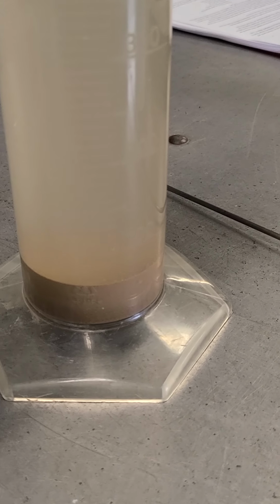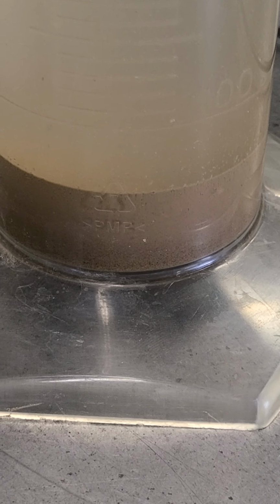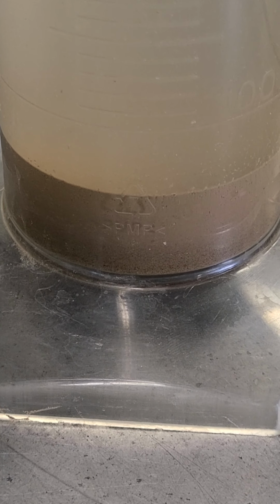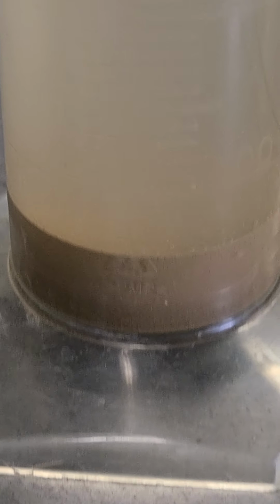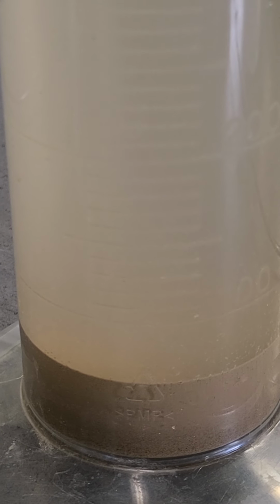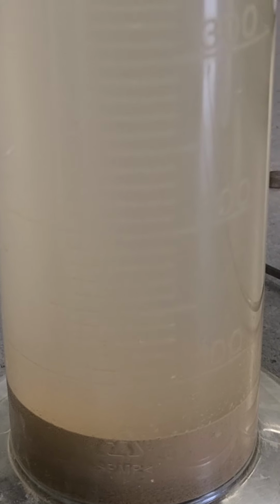I'm going to go ahead and zoom in on the stuff on the bottom, see if you can see the sediment pretty well. And if you look closely, you can actually tell that there's different sizes of that sediment, with the coarsest sediment on the bottom and the finest sediment on the top. And if you look just above that, it looks like it's just a little cloudy, which means that there could possibly be a little bit more stuff falling out. But by and large, it looks like everything's fallen out in this 3 hour period.